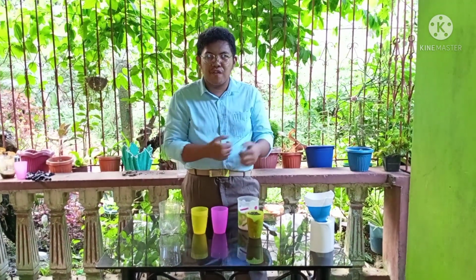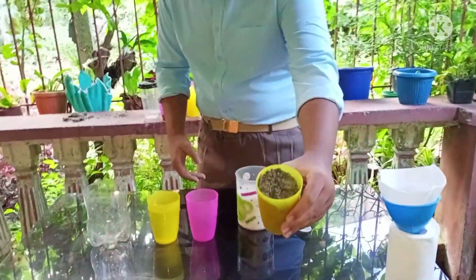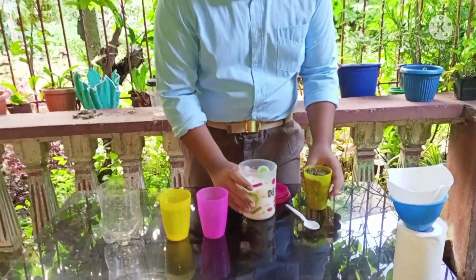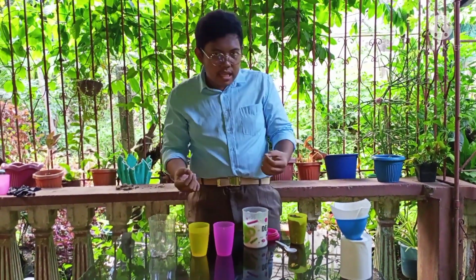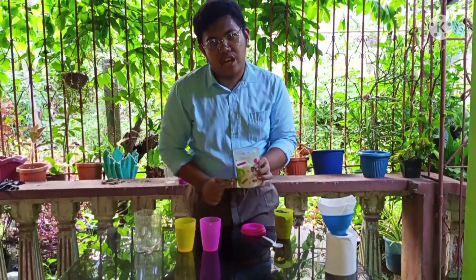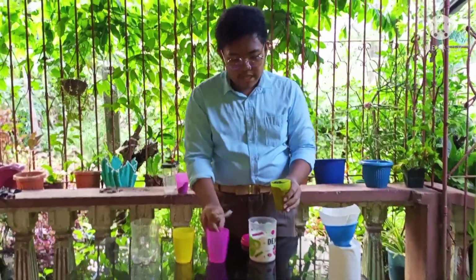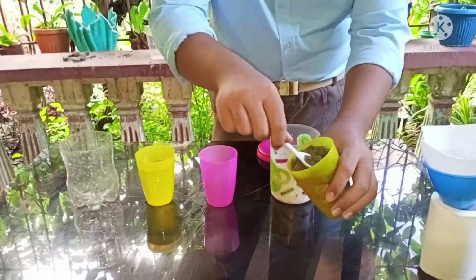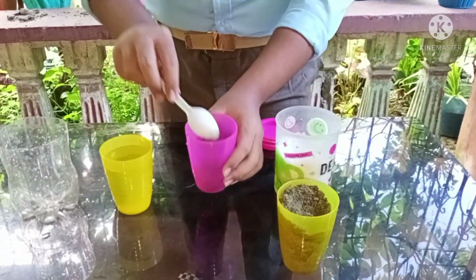Now we have come to our final one. We first mix the sand and the salt. Now, you wonder, how do we separate sand and salt when they are mixed? Do we hand-pick it? No. First, we dissolve the salt because it is a soluble material. Now let's get one scoop of each material. First is the sand. Pour it here.